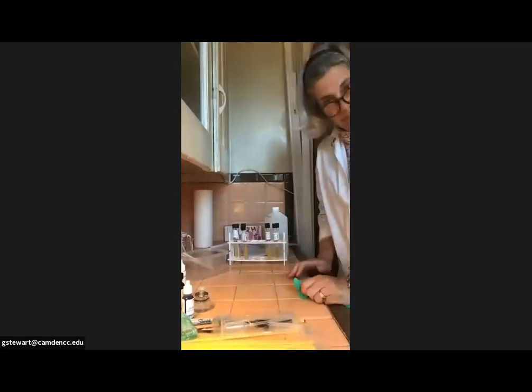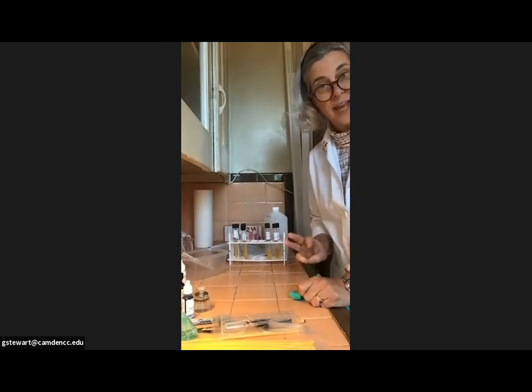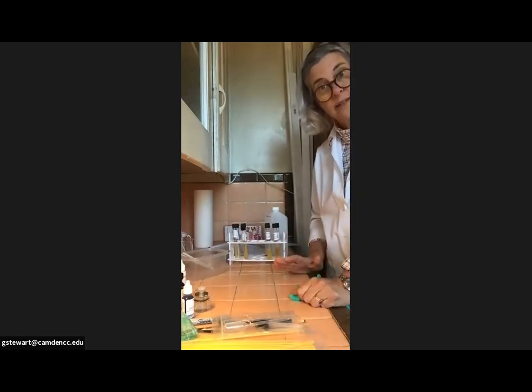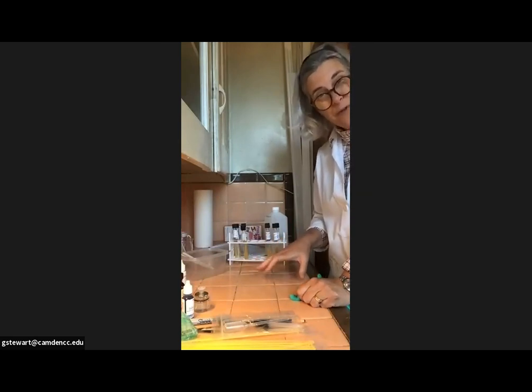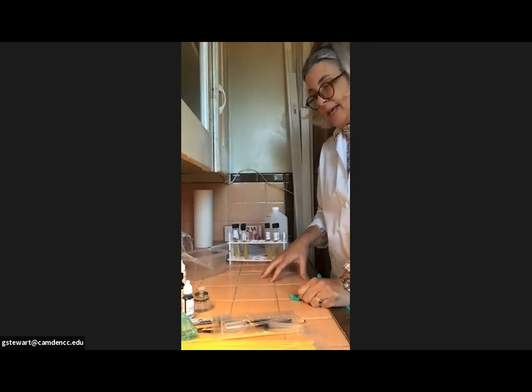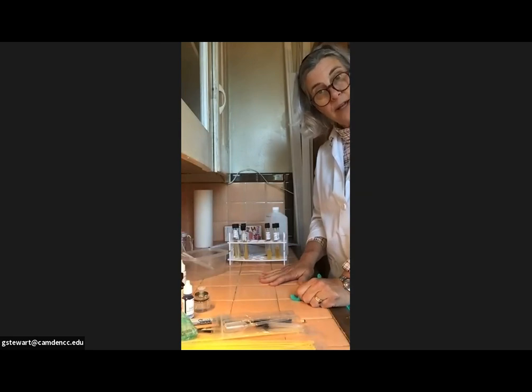All right, Microbiology 221 students, today is day 3, and today is probably the longest day. There are several ways to divide it up so that you only have to do about 45 minutes, half hour, 45 minutes of work at a time. So there are some ways to divide it up. What I would suggest is the following.